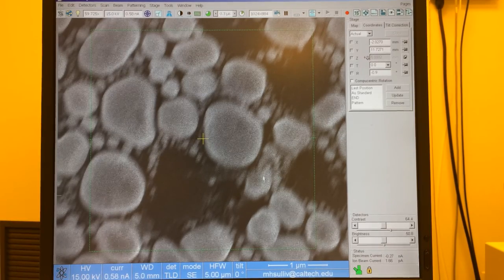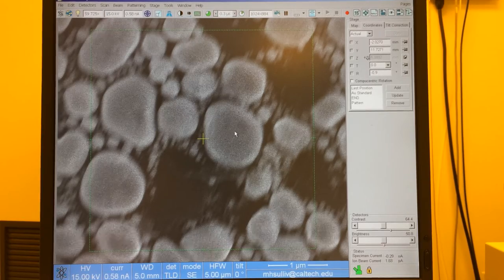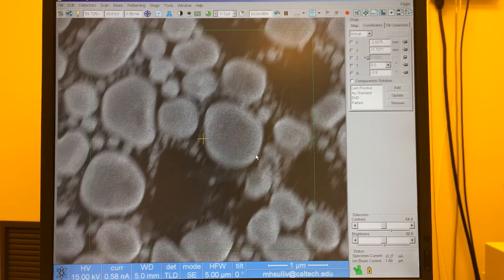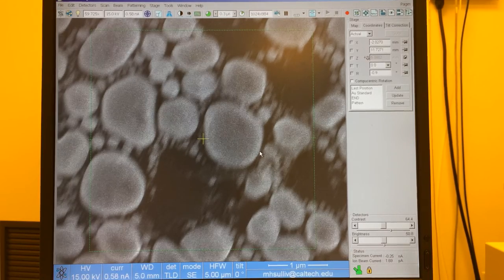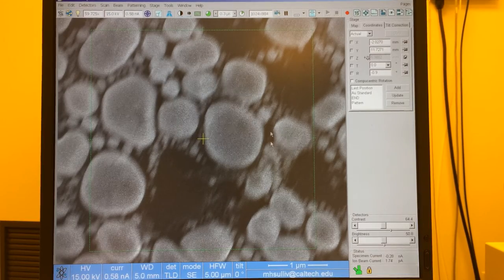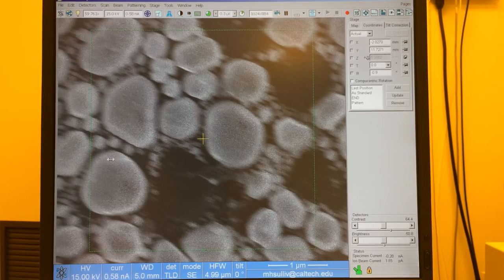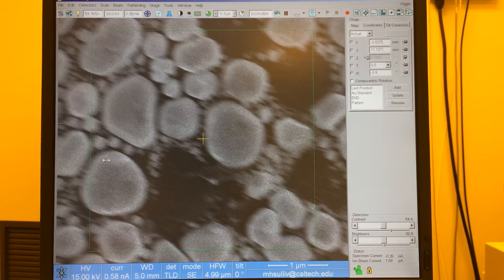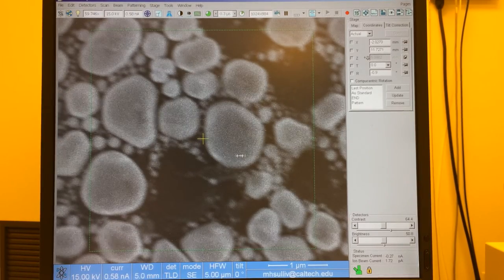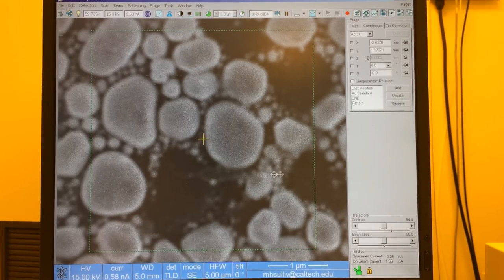So this means that while I'm fixing astigmatism, if I notice that the image is stretching, then that's my visual cue that tells me I'm not on the right focal plane. I'm not contacting the surface with a circle. I'm contacting it with an ellipse, and I'm just changing the shape of that ellipse. So as soon as I see that, I want to go back to focus. I can go to the other side of focus, and I can get that stretching to rotate 90 degrees. I'm going to find what I refer to as an inflection point in between, where we have equal blurriness on all edges. This is focus.